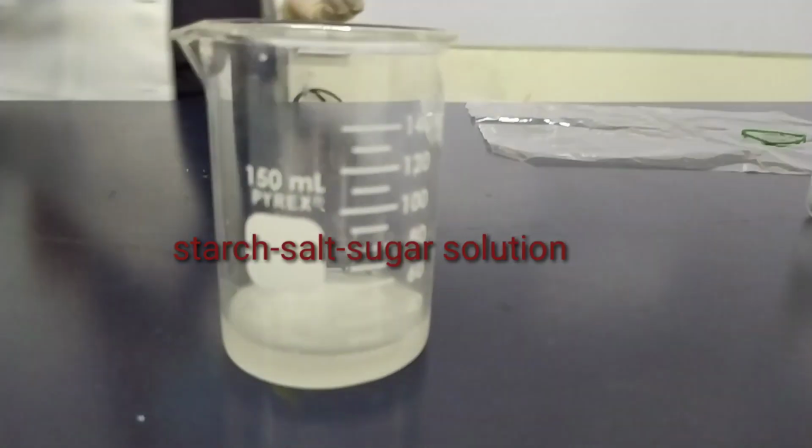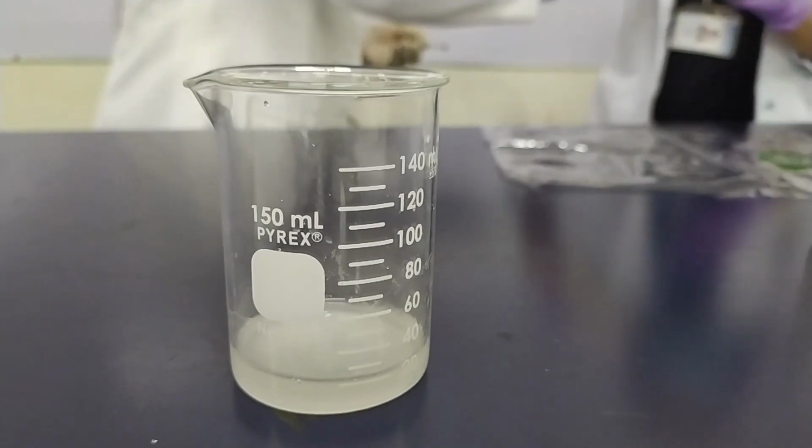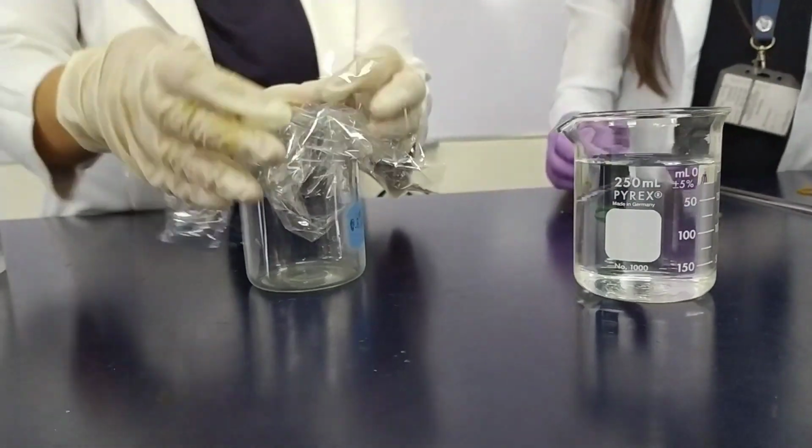So this is our starch, salt, sugar solution. You have to pour some from that solution into the sausage bag.